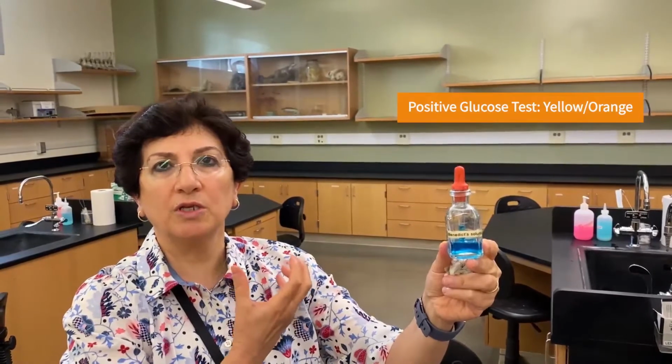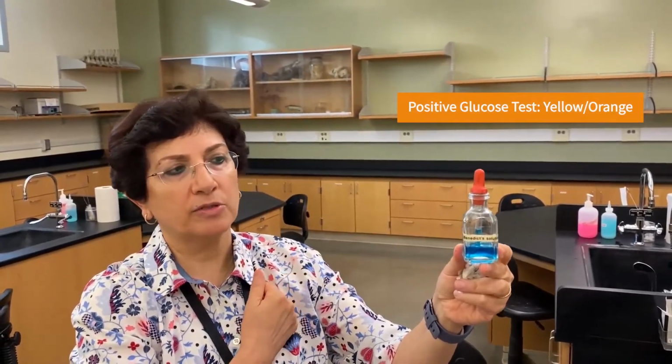The color will change from this blue to almost orange juice color if glucose is present. We'll talk a little bit more about this test once we get to this point. But for now, let's remember that this particular solution, Benedict's, is used to test for the presence of glucose.